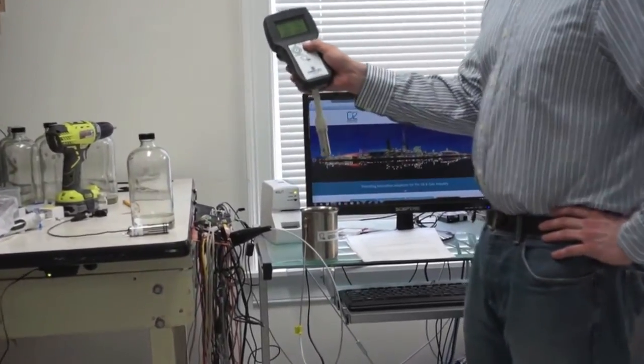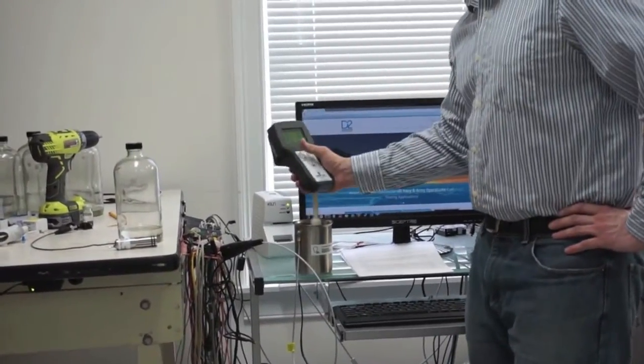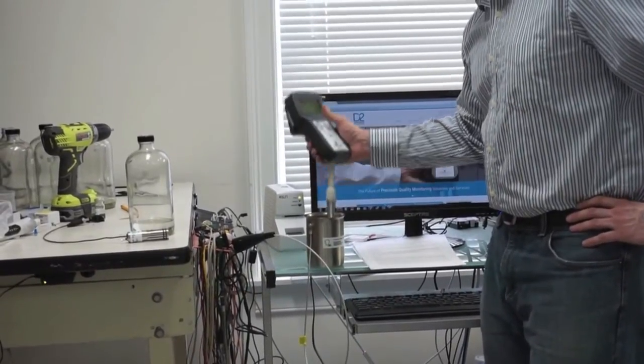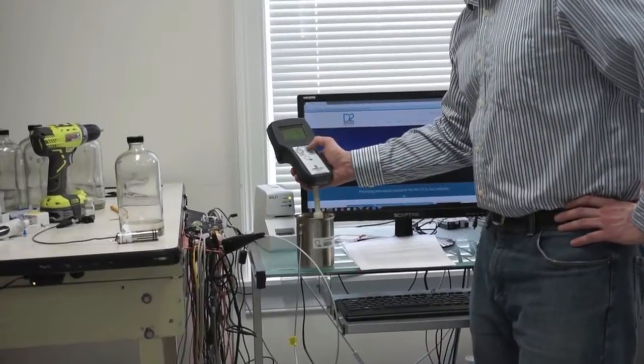Before you hit enter to take the measurement, you want to put the sensor tip into the fluid and mix it around so that the sensor tip mixes the fluid evenly.